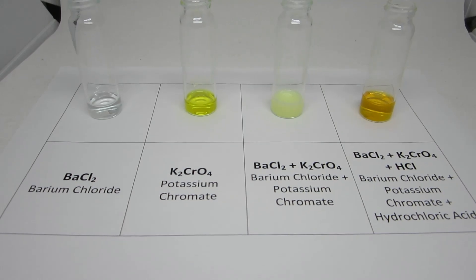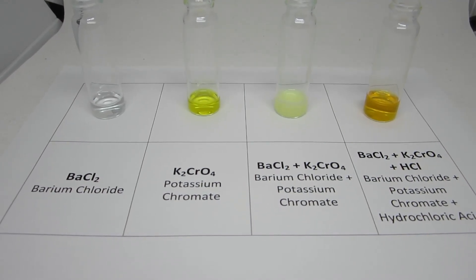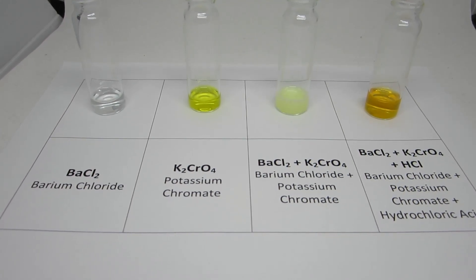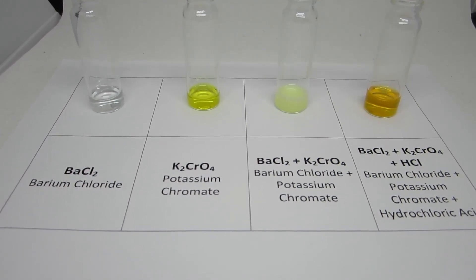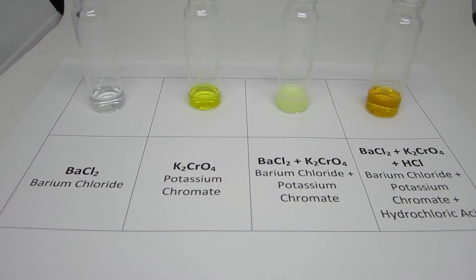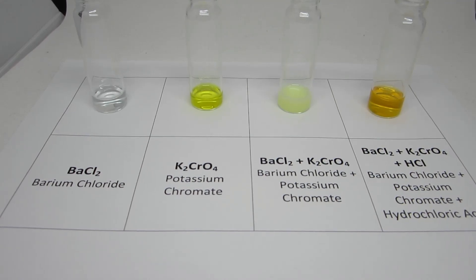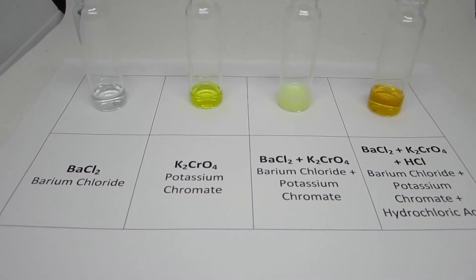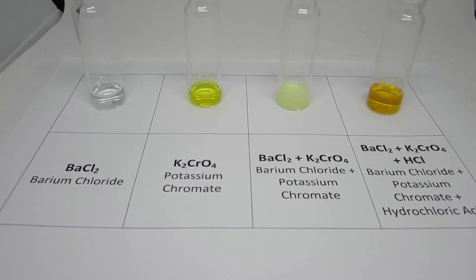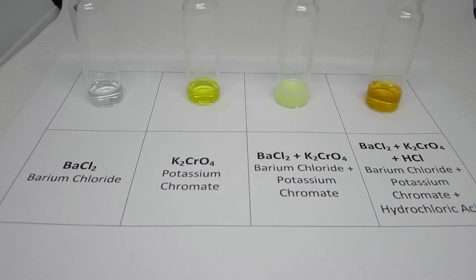Overall, the clear and colorless barium chloride reacts with the yellow potassium chromate solution to form a pale yellow precipitate of barium chromate. Upon addition of hydrochloric acid, the barium chromate precipitate dissolves and the resulting solution is a clear orange color.